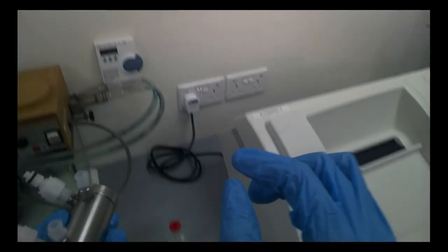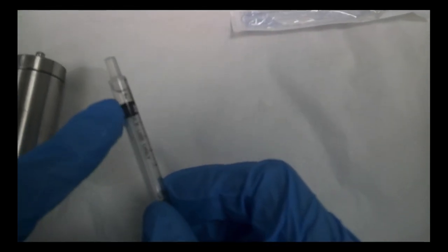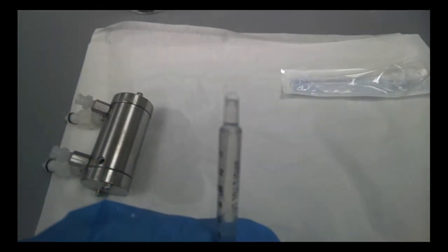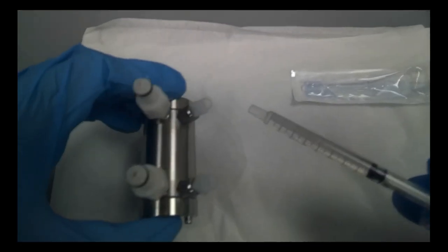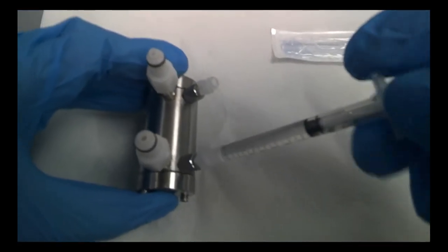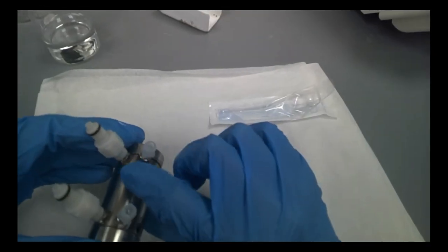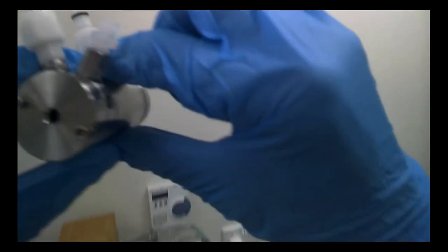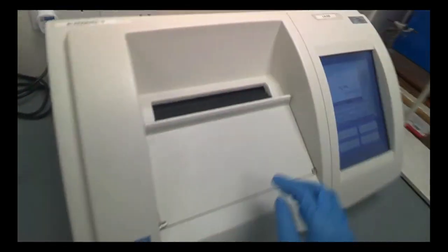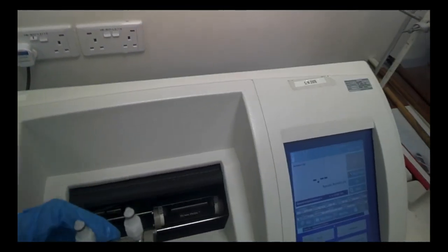Okay, there were some bubbles here, so what I need to do is, you see how it happened? It happened because here I have some bubbles, so I need to eject out. Take out some and then make sure there's no bubbles in this syringe, and do that one more time. Push it in from the other side. You see, good. Now let's do one more check. Right, now there's no more bubbles.